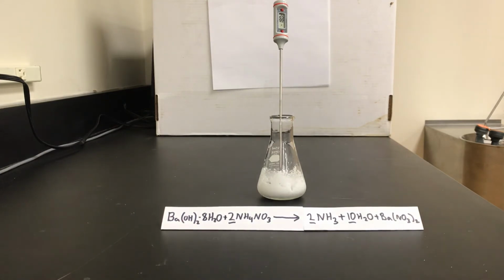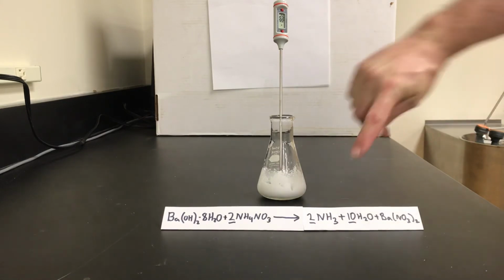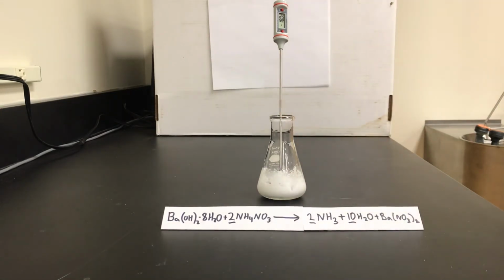Now, a few other things about this reaction are interesting. It was a solid phase reaction. One of the products is ammonia. If you were here in the lab with me at the moment, you would probably want to plug your nose, because the smell of ammonia is steadily coming out of this flask. So if anybody were asleep in here, this would certainly wake them up.